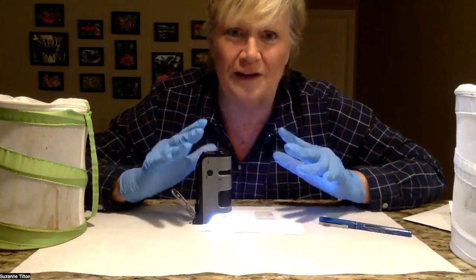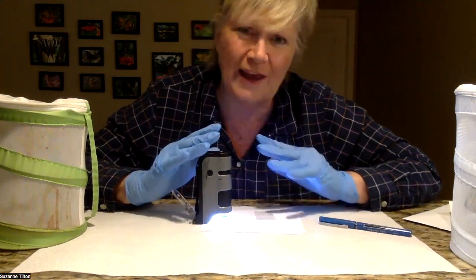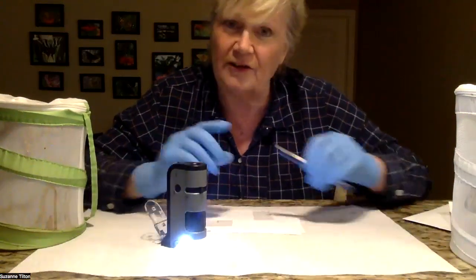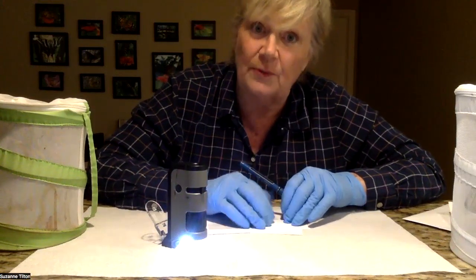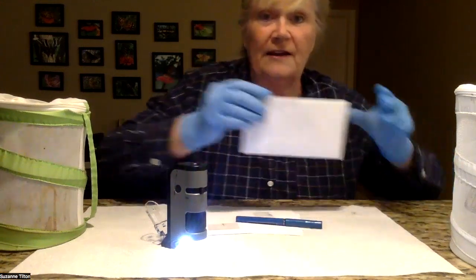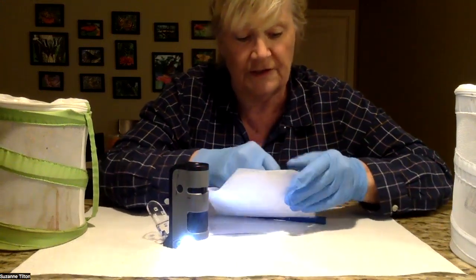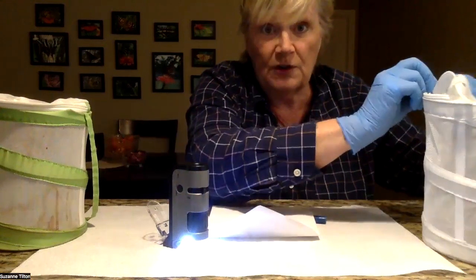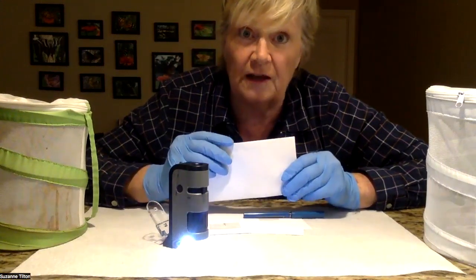I'm almost sure none of these butterflies have OE because I use really good techniques and practices to prevent OE, although you can't always guarantee that. If you want to keep track of butterflies, you can write down the date, whether the butterfly was male or female, and keep track that way. Since this butterfly is OE-free, I will remove it and put it back in the cage. But if it happened to have OE spores on it, I would take the envelope, place it in the freezer, and euthanize the butterfly.